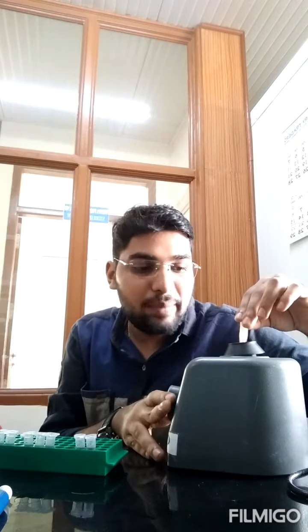When I give this mixture, what happens? All the components get thoroughly mixed, and only that component which has that red layer will come up. So now you can see there is a uniformity there. You will allow it to settle down. Leave it for a few minutes, and then I will show you the distinguishing between 2 layers.